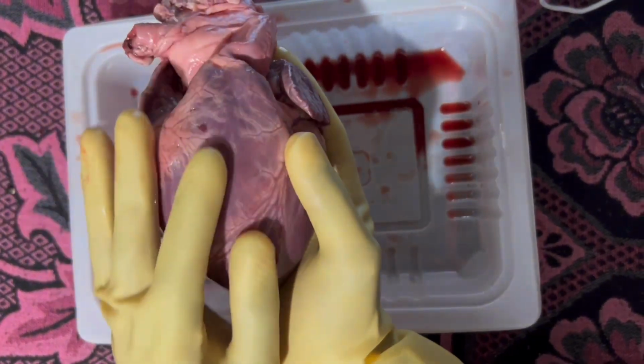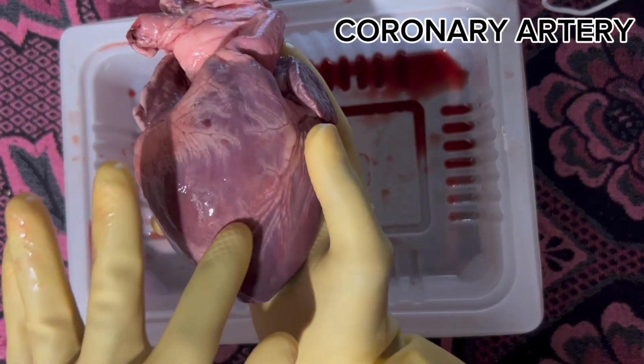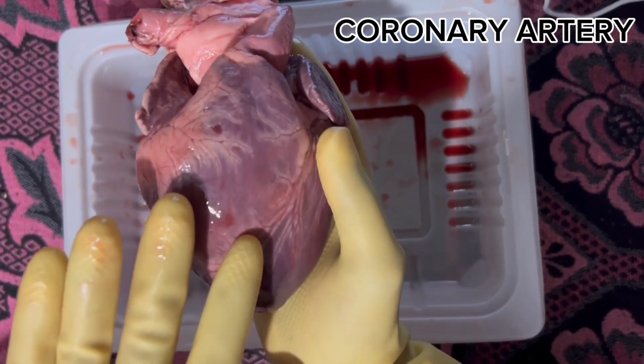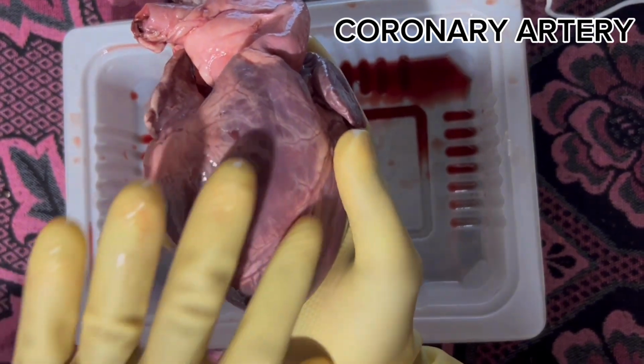Next is the coronary artery. The coronary arteries start at the base of the aorta and are also present at the back side of the heart. So the function of the coronary arteries is to supply blood to the heart muscle.